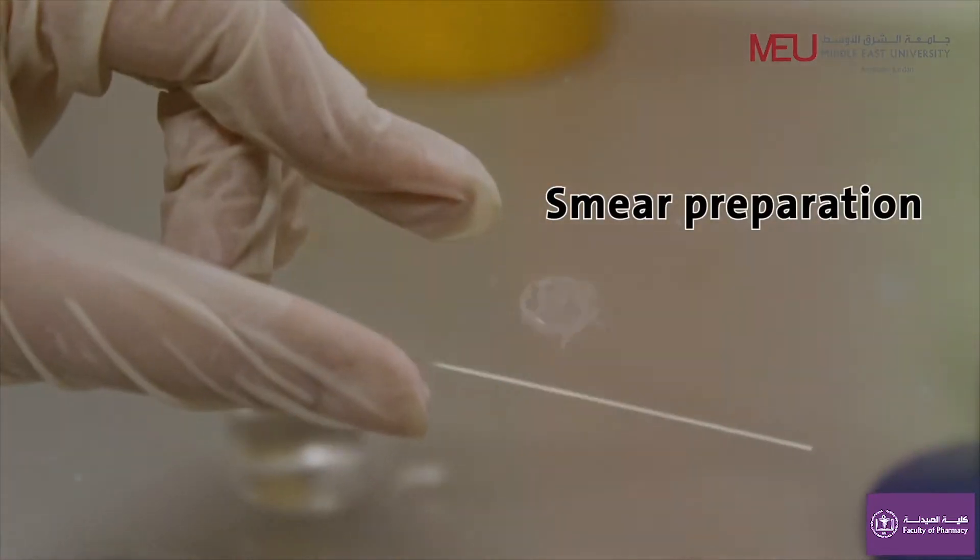Dear students, welcome to the microbiology lab. Today our experiment is to prepare a smear.